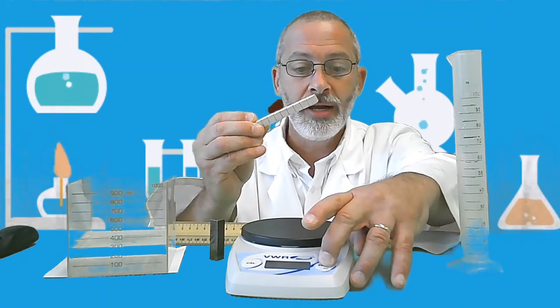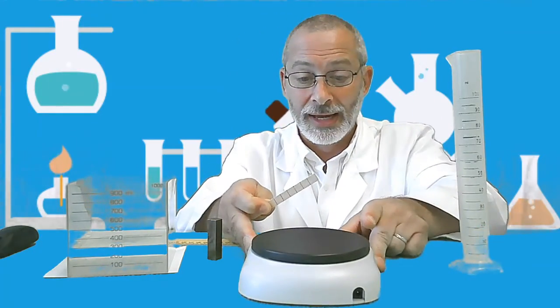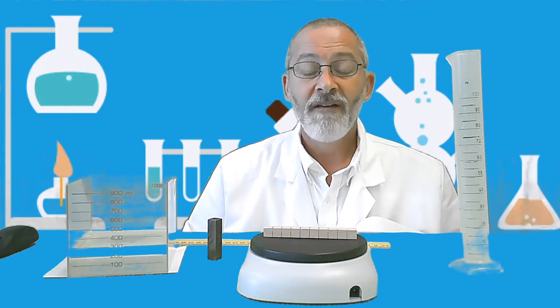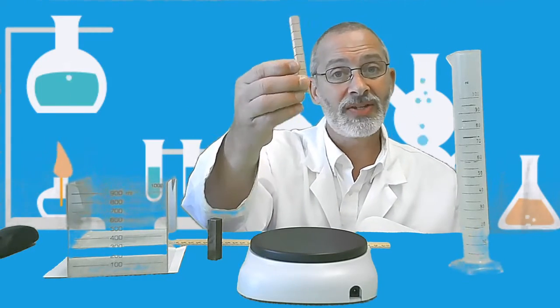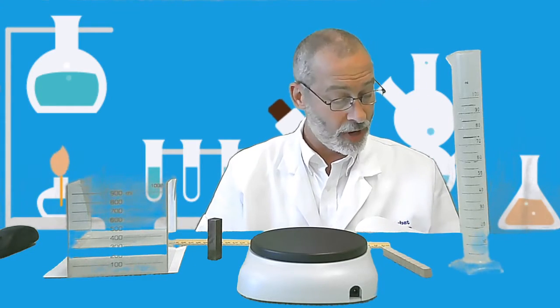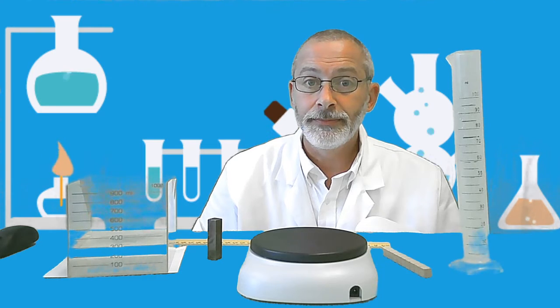And I'm going to turn on our digital balance here. And I'm going to turn it around so I can see it a little bit better since you can't really see it anyway. So I'm going to read the mass. Oh, that's easy. The mass of this object is 5 grams. 5 grams is the mass of object A. Now, it says record your data. So go down into the observation section where it says mass in grams of object A. Write down 5 grams. Next step.